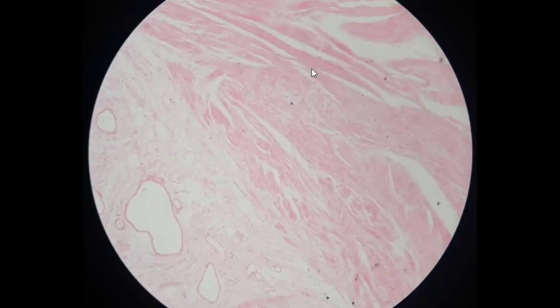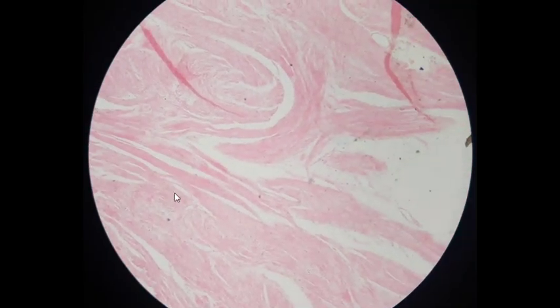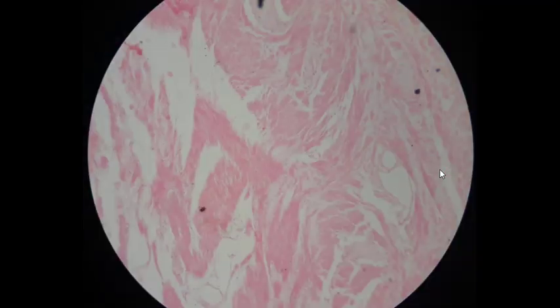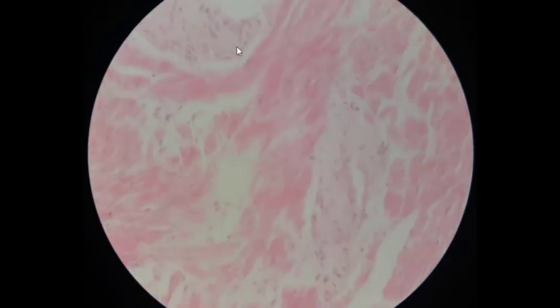And here, the muscularis externa. Note that the smooth muscle is oriented in several different planes. The myenteric plexus or Auerbach plexus is located between the outer and adjacent inner layers of smooth muscle and is clearly evident on this slide. Let's find it with higher magnification. Here they are.